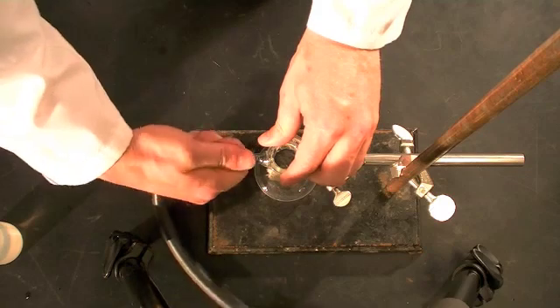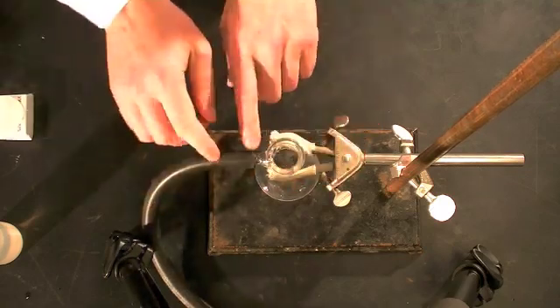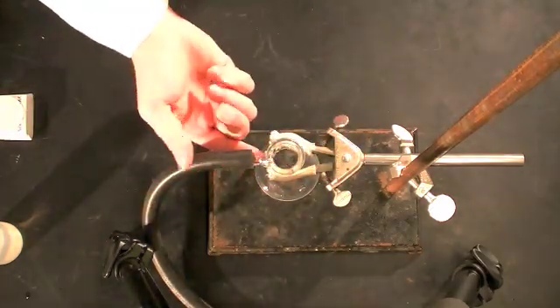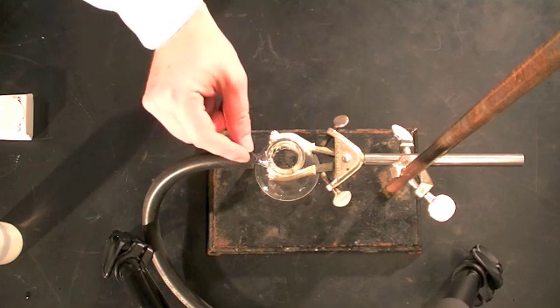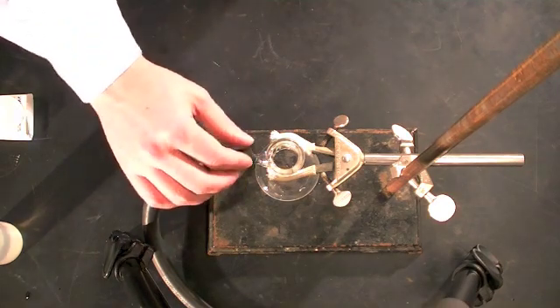Now, if you have a small hose you may find it difficult to get it on. So you can lube it up with a little bit of water and that will help you slide it onto the sidearm.